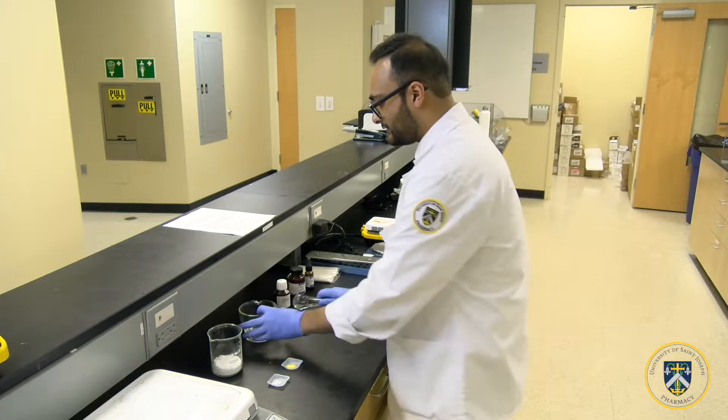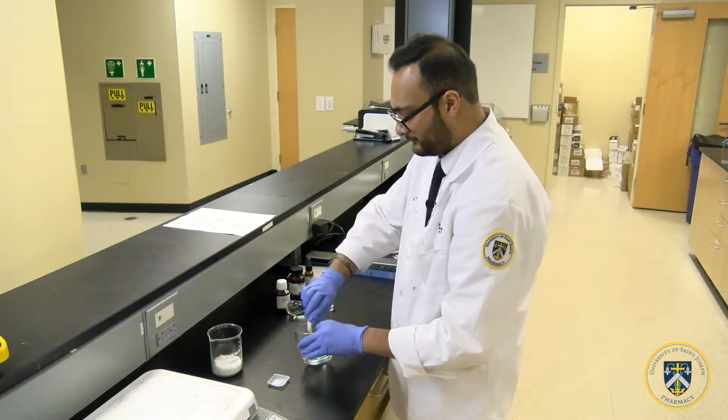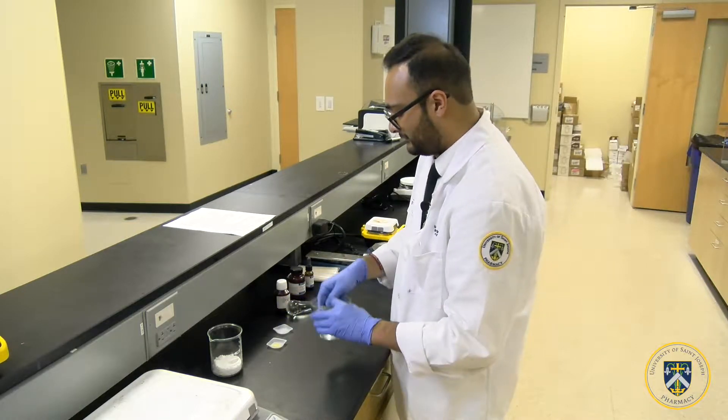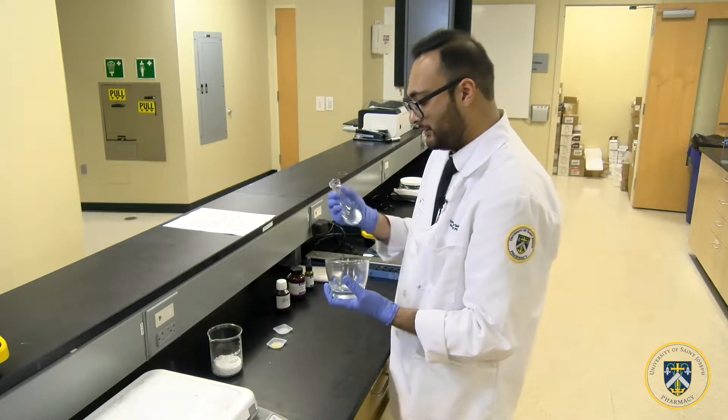Add your Nystatin powder and your lactose monohydrate powder to the mortar and pestle and triturate. This will reduce the particle size.